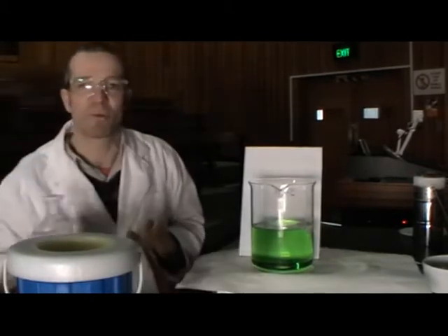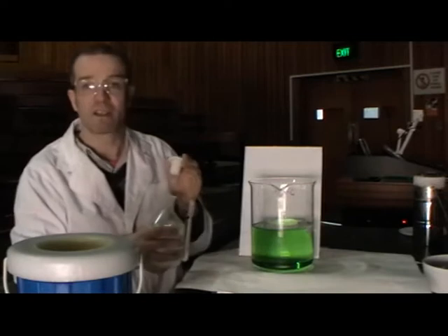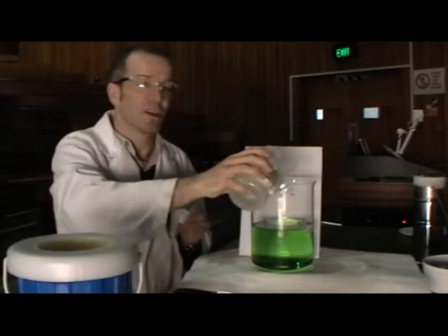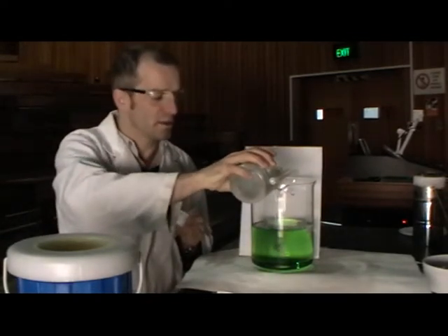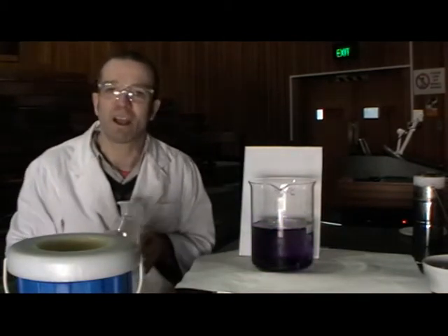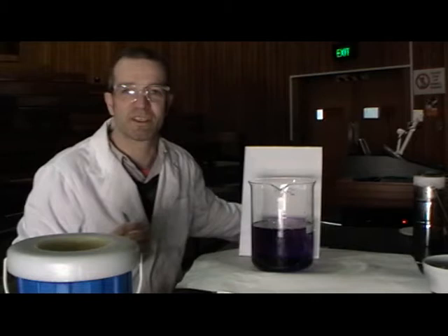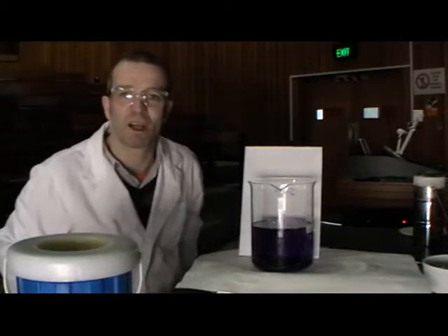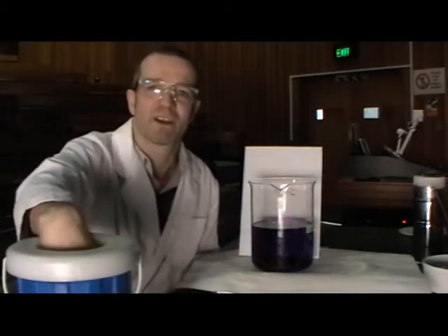I'm going to add some sodium hydroxide, which of course is an alkali, so it should go a nice purple color. We've got the presence of alkali in the solution now. The universal indicator turns purple, indicating a basic alkali solution.